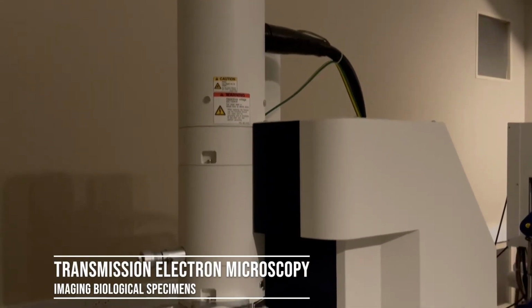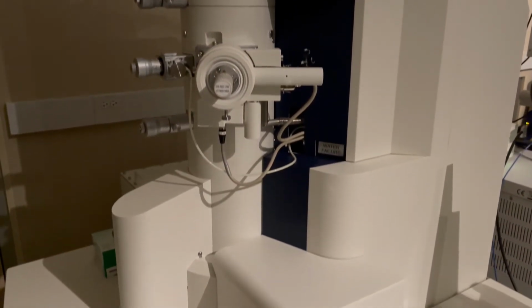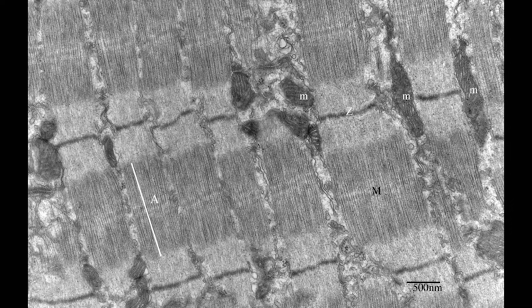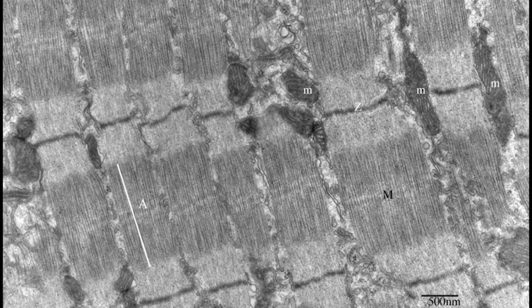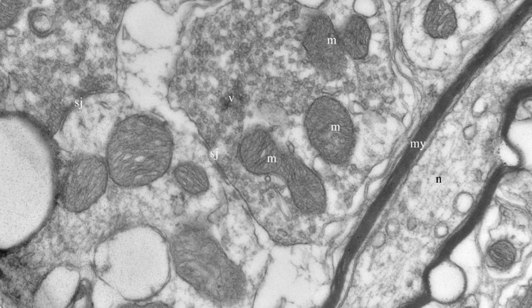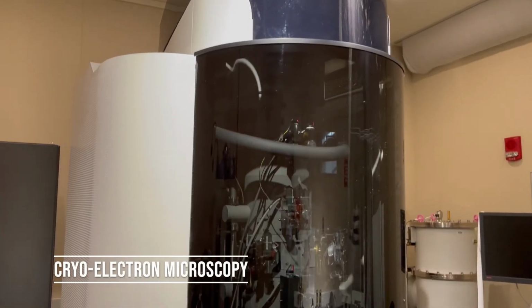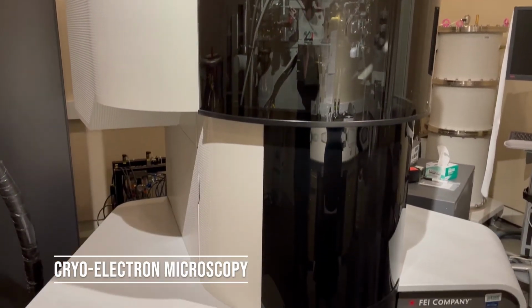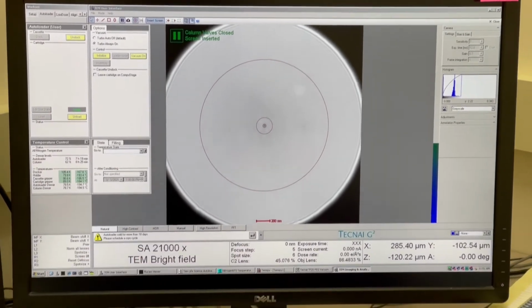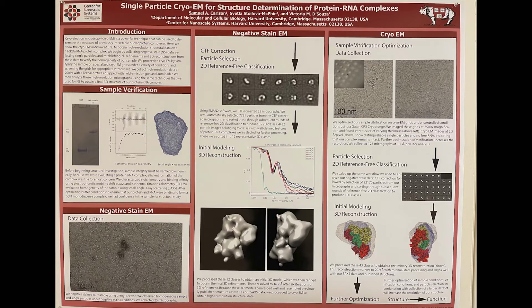In addition to SEM imaging, we also use transmission electron microscopy to study biomolecular systems. TEM allows us to study details of the ultrastructure of biological specimens, including cells, tissue, whole organisms, and plants. Cryo-electron microscopy allows researchers to study soft material systems in single particle analysis and structural biology in their native physiological conditions.